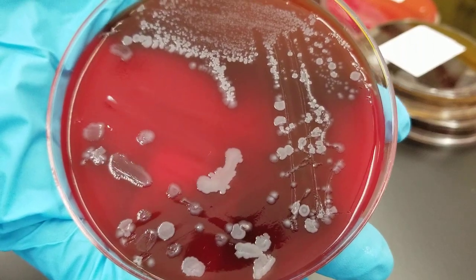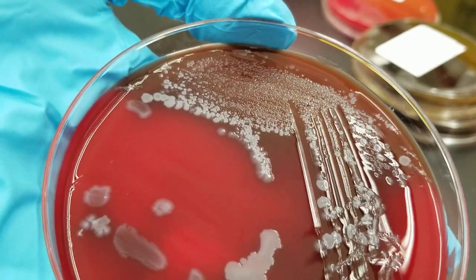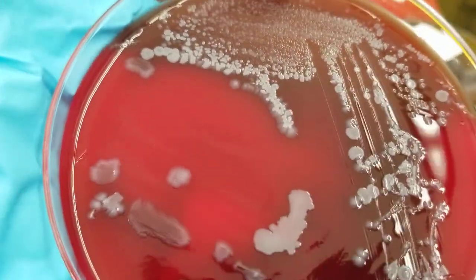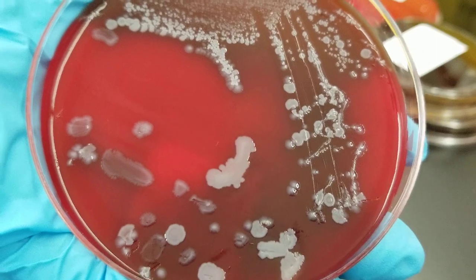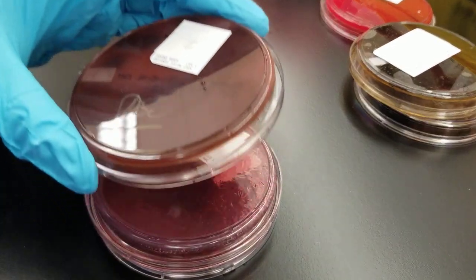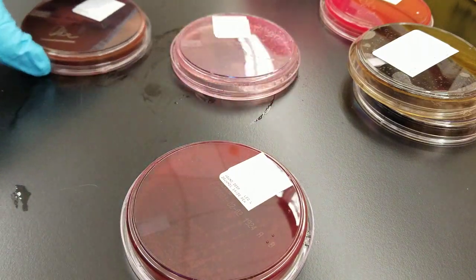It's a wound and it looks very pathogenic — it's taking over the plate. There's a kind of sheen on the gray colonies, and they did work up the gray ones. It is a pathogen, though I don't know exactly what it is as I didn't get the report. It did not grow on the MacConkey. The plates are frozen, but it looks very staph-ish.